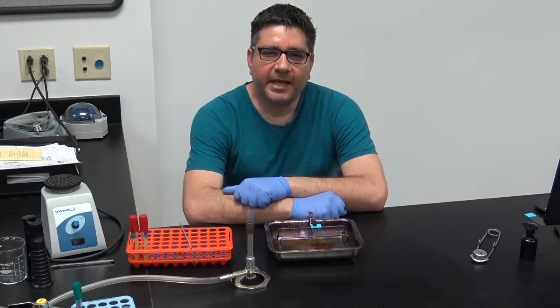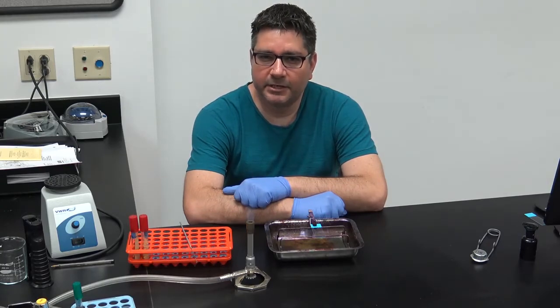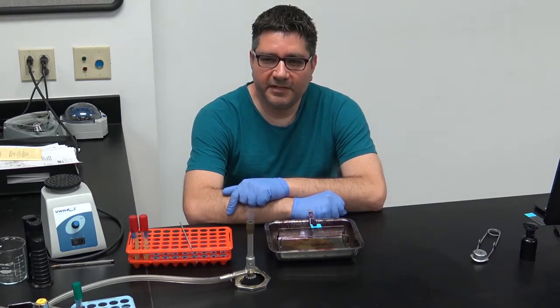Today we'll be using a primary stain, carbolfuchsin, decolorized with acid alcohol, and counterstain with methylene blue. You will follow the same procedure for your bacterial smear preparation. It is recommended to cover the specimen with tissue paper, but it can also be completed without this. You'll be using the steaming technique in order to allow for the primary stain to penetrate the cell.